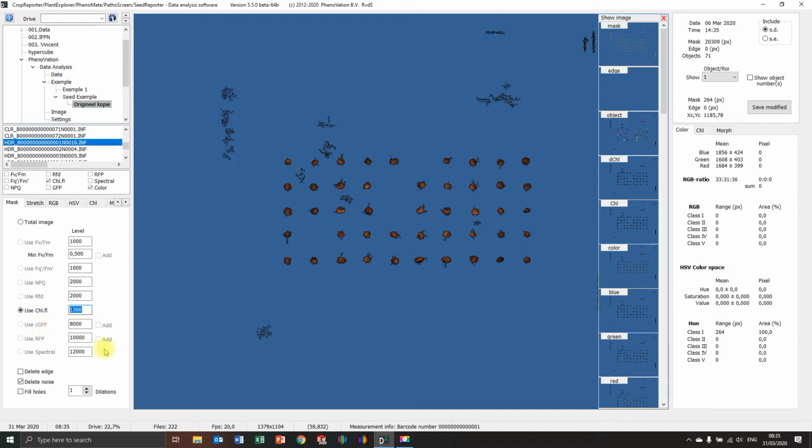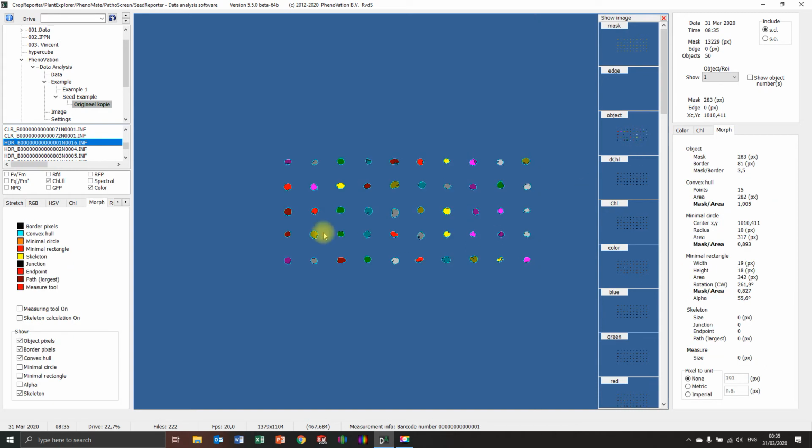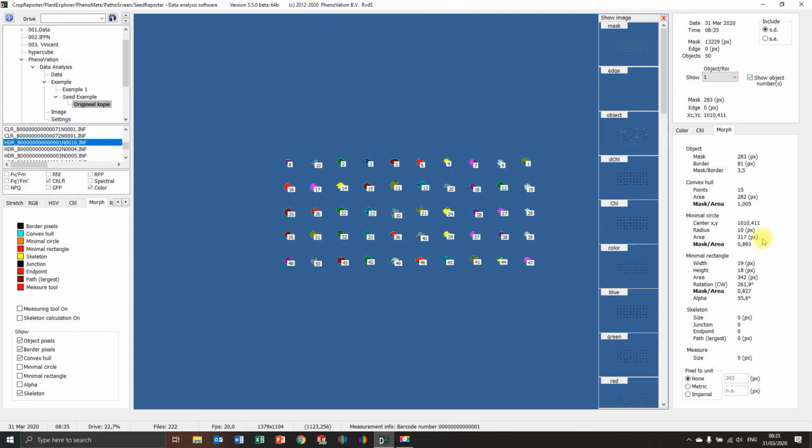Let me see. 1350-ish, I had it on. Yes. So now you can say save modified. And when you come back to this file, you have it saved. And then you can also really calculate the individual object sizes and everything like that. That could be really interesting.